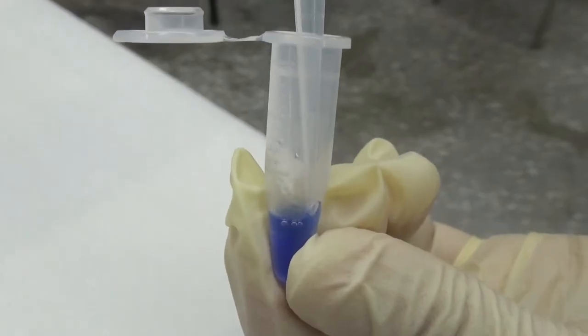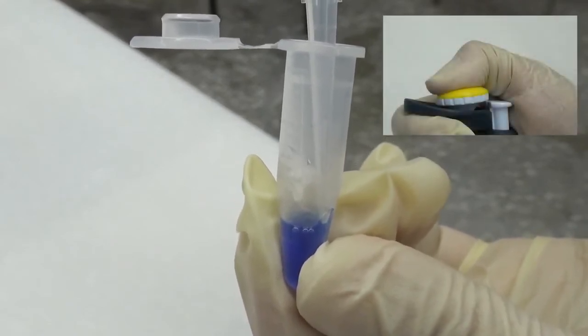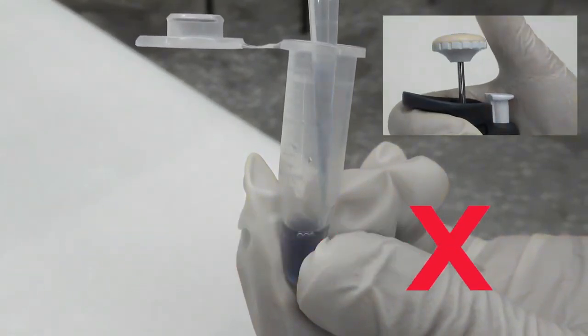After dispensing the liquid, if the tip is still in the solution while the button is released, the liquid will be sucked back and cause problems.